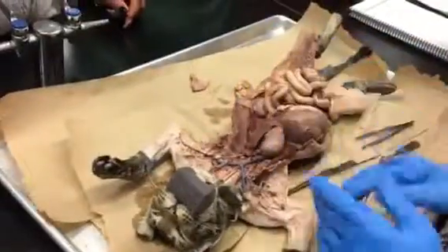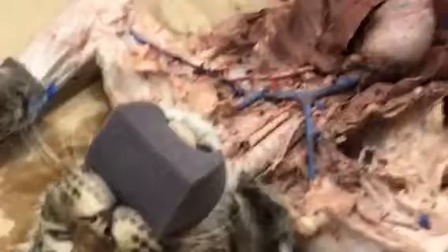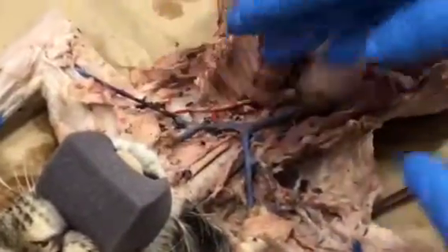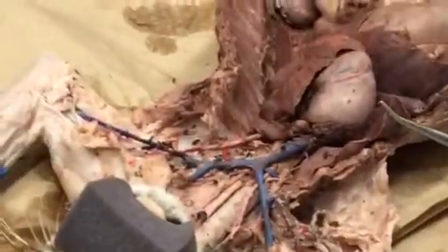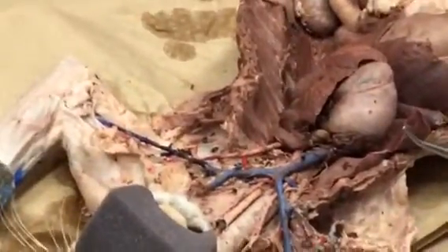What I'm going to do is start at the top with the arteries, and I'll go from the heart up to the arms and head, and then I'll go down the center of the body to the legs, and then I'll finish up with the veins, okay? So if you're ready to go, I'm going to do a countdown: 3, 2, 1. You ready? Mm-hmm. 3, 2, 1.